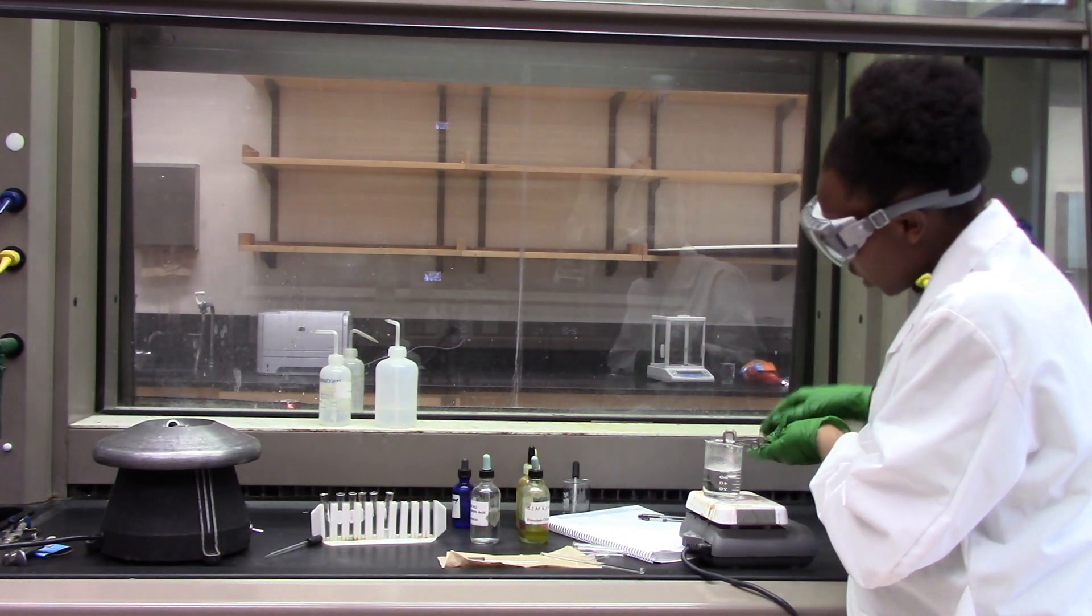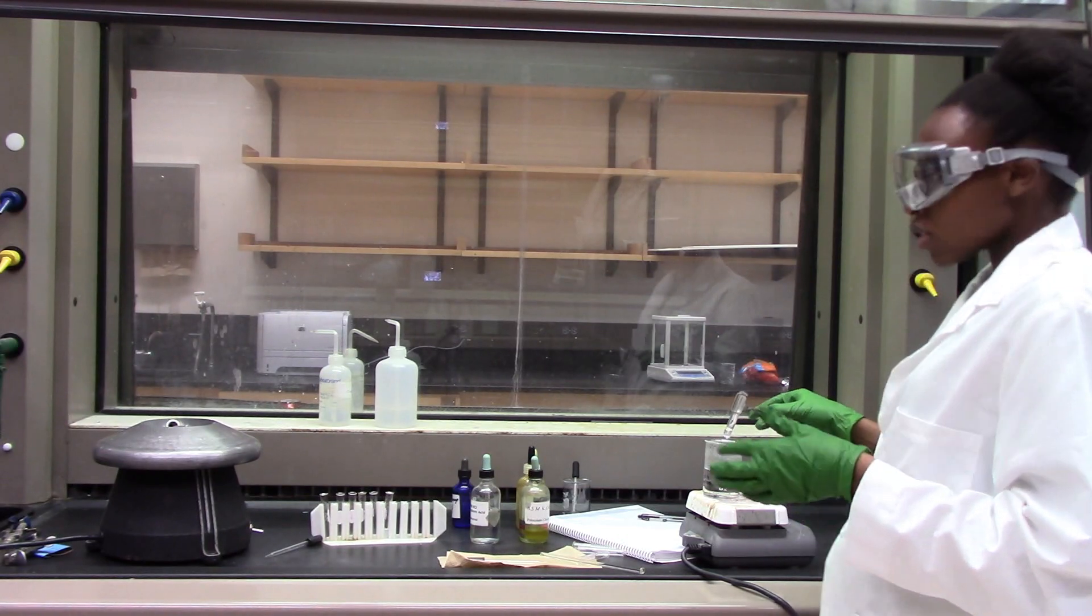Once this is mixed all the way, I can also centrifuge.